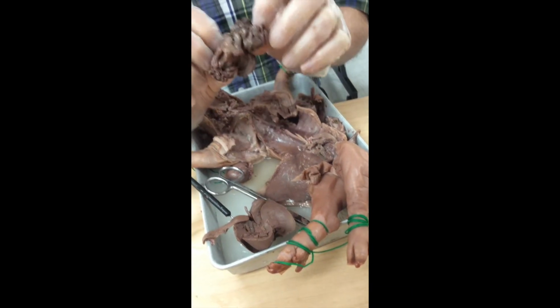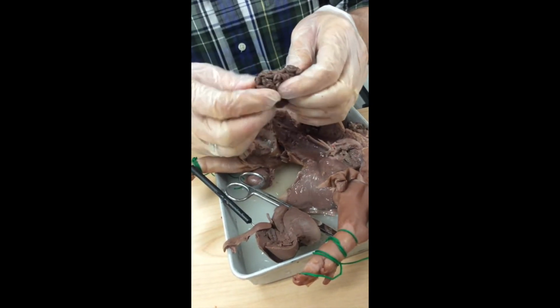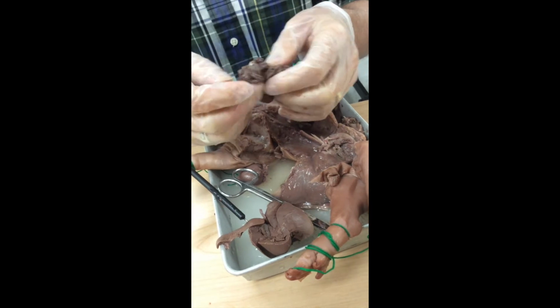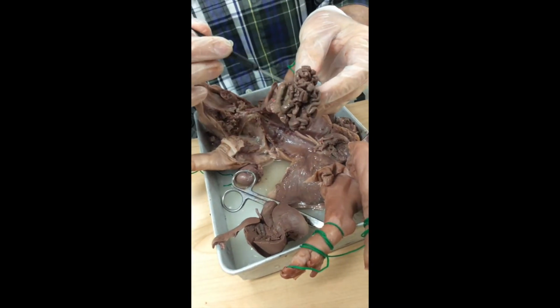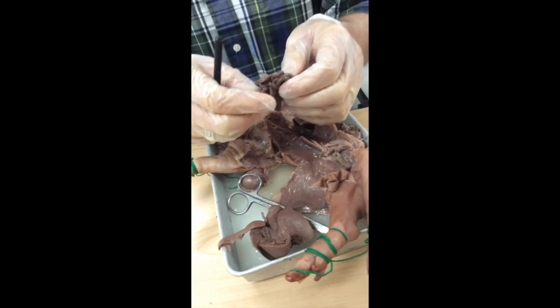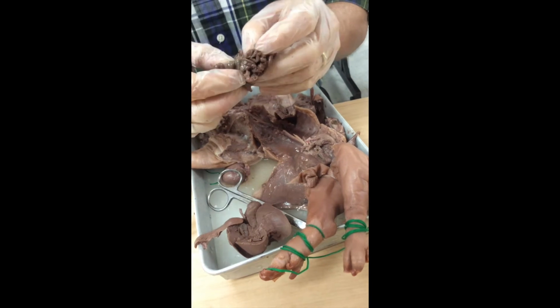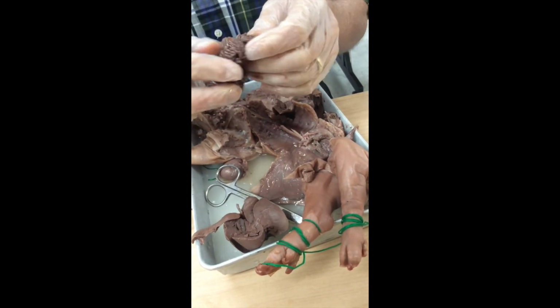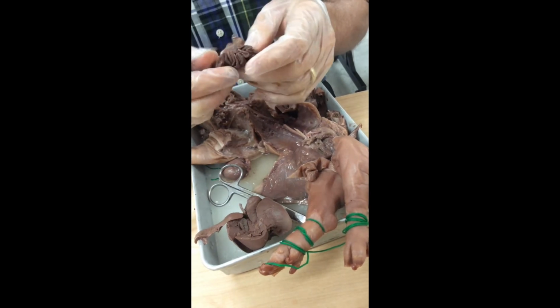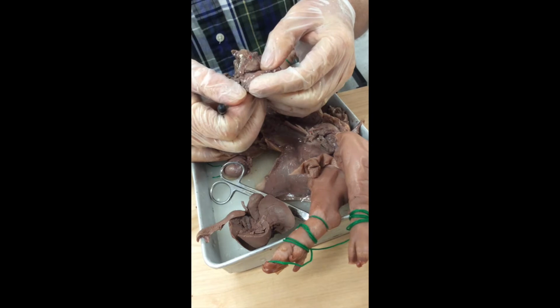All right, so now we've got all this intestine. I think one of the things that you guys can do as part of this class, as you finish things up, we have the great intestinal tease competition. I'd like you to take your tease needles and your scissors, and see if you can get this intestine torn apart and turn that into a big old rope. We've had intestines that have stretched over 300 centimeters before. Let's see what we can get in terms of a maximum length with you guys, without breaking it.